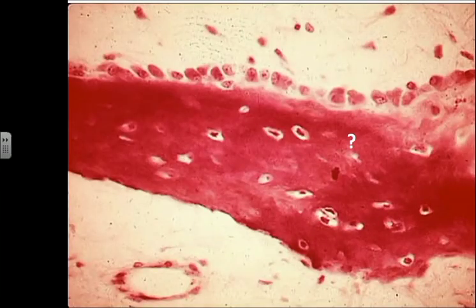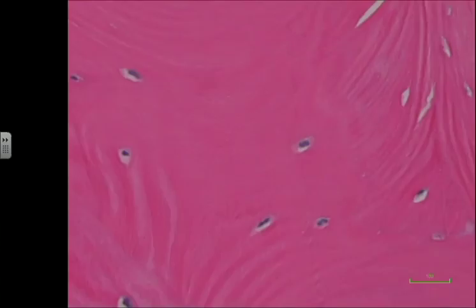And the last question, just to make sure we put it all together. So this is a bone spicule or piece. My question: what's the name of the cell highlighted by the yellow arrow? What's the name of the cell highlighted by the blue arrow? What's the name of the cell highlighted by the green arrow? What is the question mark? What do we call this matrix? What type of matrix is it? And which tissue does it belong to? And what's the name of the cell highlighted by the black arrow? We can have the yellow and black be the same type of cell, so don't get confused.